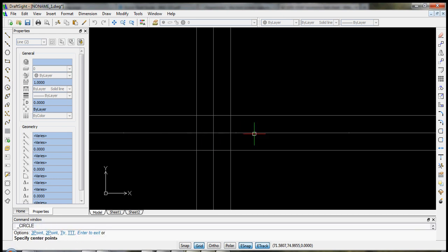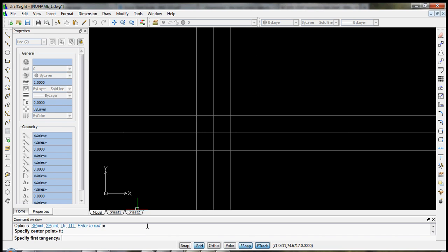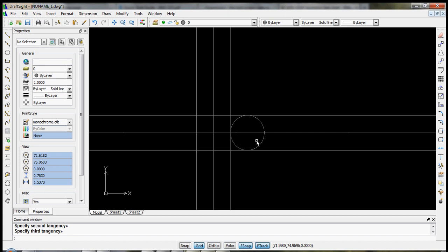So let's take our circle again. We want to make a circle that basically fits within this pattern over here, kind of in the shape that I'm moving the mouse. We want to make sure the tangents line up with the 2 outer edges of the 150 micron wide channel, as well as this point right here. So here we've got a couple of options. We've been doing a center radius definition, but we can also hit TTT and enter, which allows us to pick 3 lines and makes a circle that's tangent to all of them. So let's click all 3 of them. 1, 2, 3, and there's our circle.